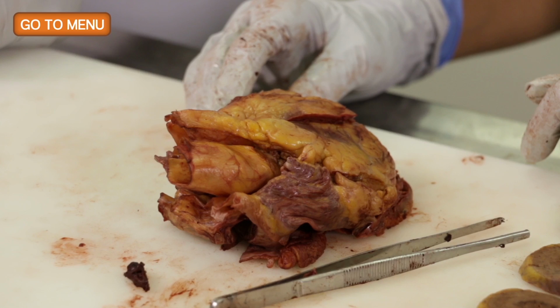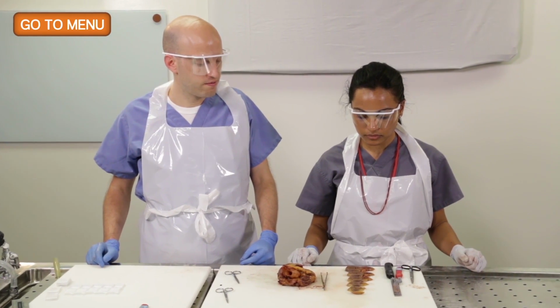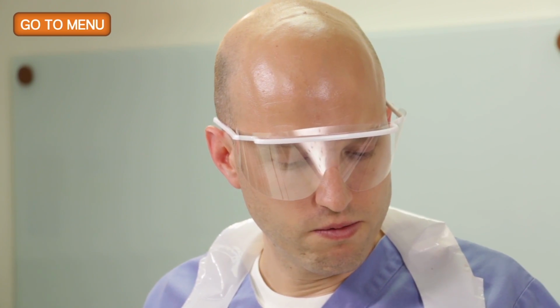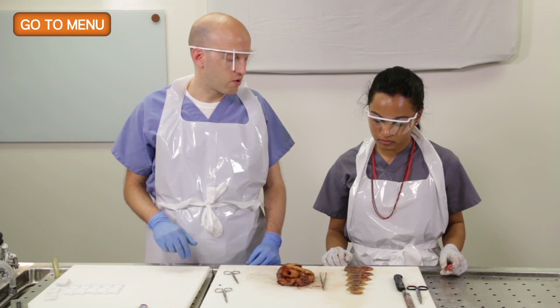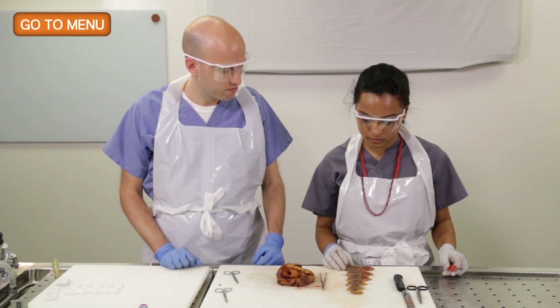So the next thing we want to do is take our sections to look at on histology. And if we don't see anything focally, then we'll just take representative sections to evaluate the entire left ventricular wall, or at least representative sections of that, as well as the right ventricular wall. So let's do that now. So what I like to do is pick one section, and I'll go circumferentially around it. So anterior, lateral, posterior, and septal. So whichever one you like the best.